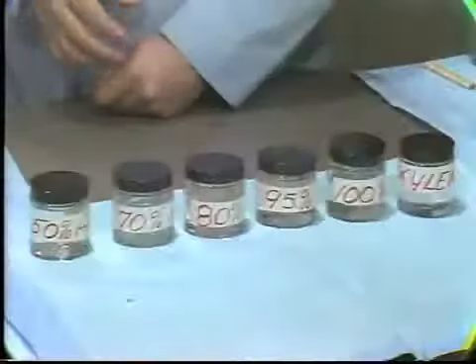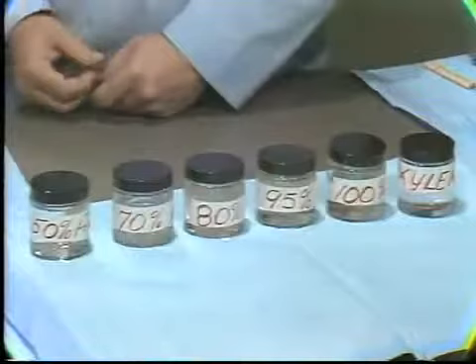If the material is a calcified material, it is decalcified before we go on to the next steps. I'm going to explain to you now just a little detail what's happening. We want to get a thin section of tissue so that we can look at it in the microscope. In order to do this, we have to embed the tissue in a material that will support it when it is sectioned to be a thin section. In order to embed the material, we have to remove the water, and this is called dehydration. This is the next step, dehydration. We've got to get the water out before we can get the embedding material in.